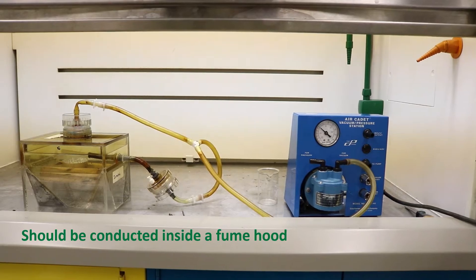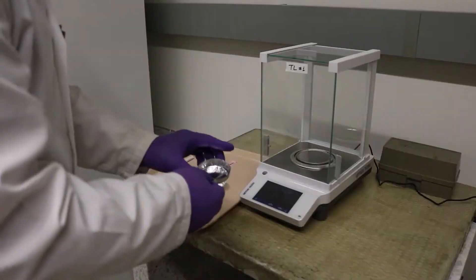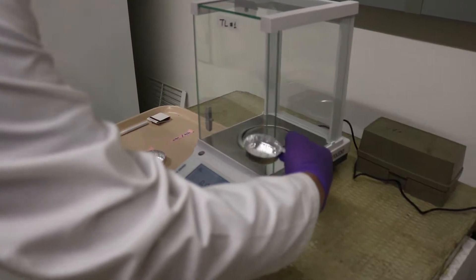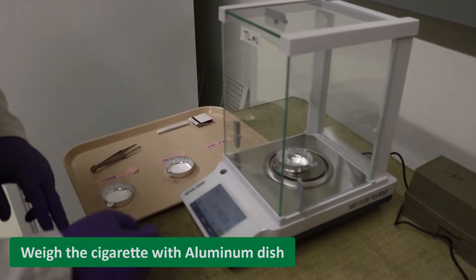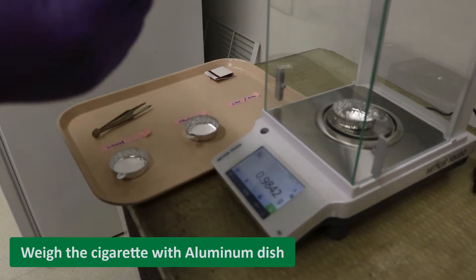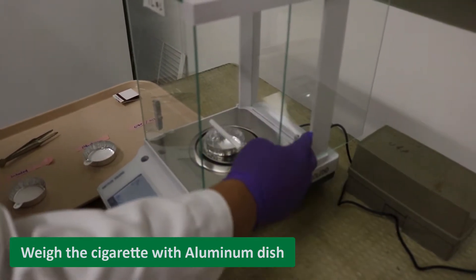The part of the experiment using the smoking chamber is conducted inside the fume hood. To start the experiment, first take a pre-dried aluminum dish, label the dish with an ID using the analytical balance, add a cigarette, and measure the weight of the dish with the cigarette. The weight of the cigarette can be calculated based on the mass difference.